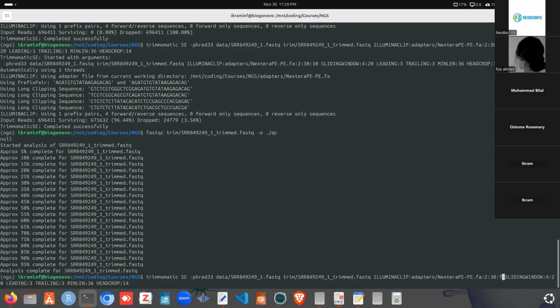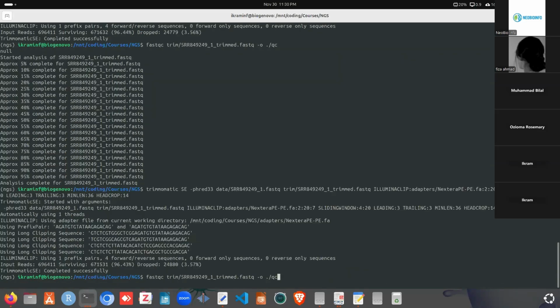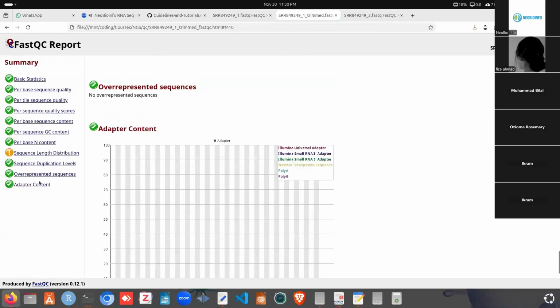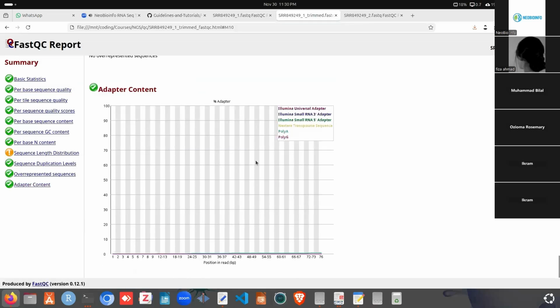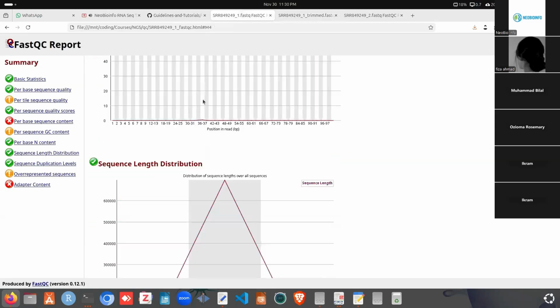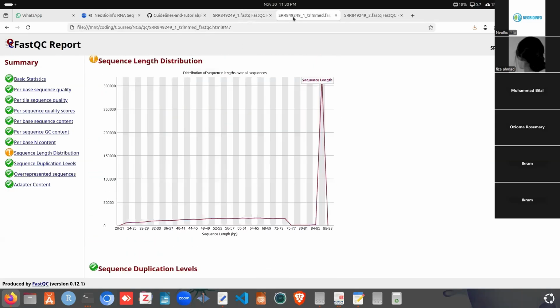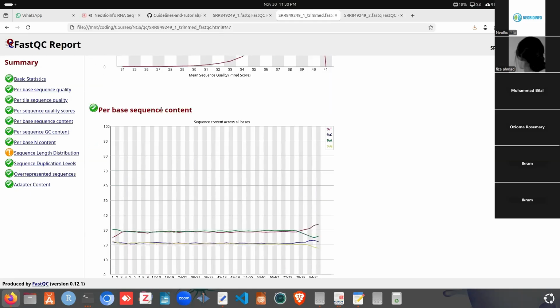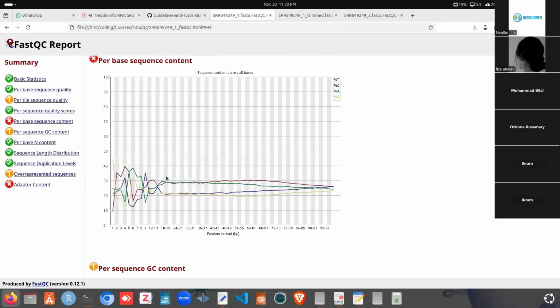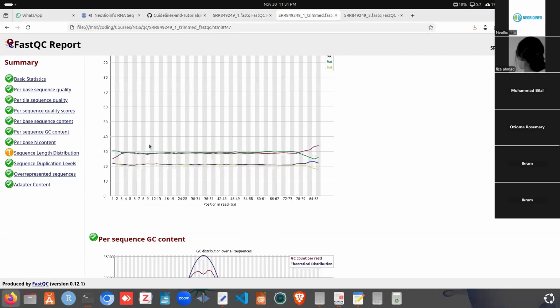If we use 7 here and run this again, we need to calculate FastQC again for the output. After reloading this, you can see the adapter content is totally removed, and these are not problematic, it's okay. For the original file, all the sequence lengths were 101, and here it varies from 20 to 88, and other things are okay. For the per base sequence content, first we had some fluctuations. We removed the first 14 bases completely, and after removing we can see it doesn't have any fluctuation now.